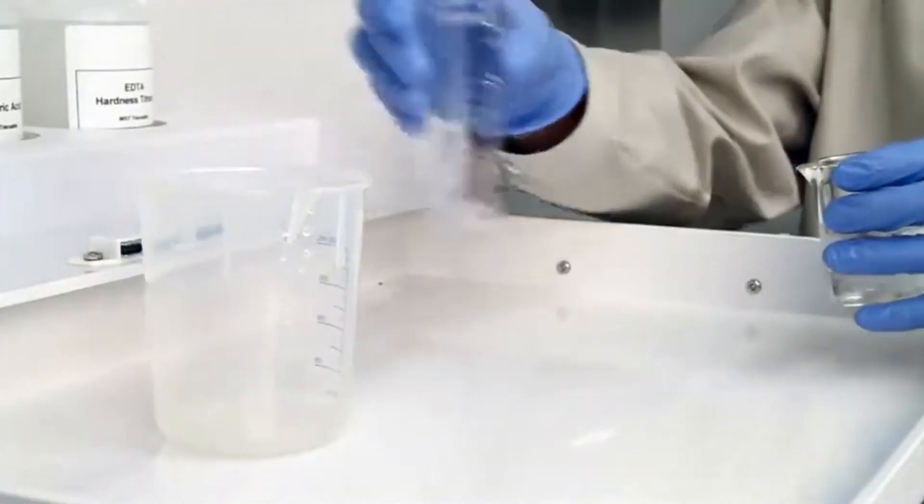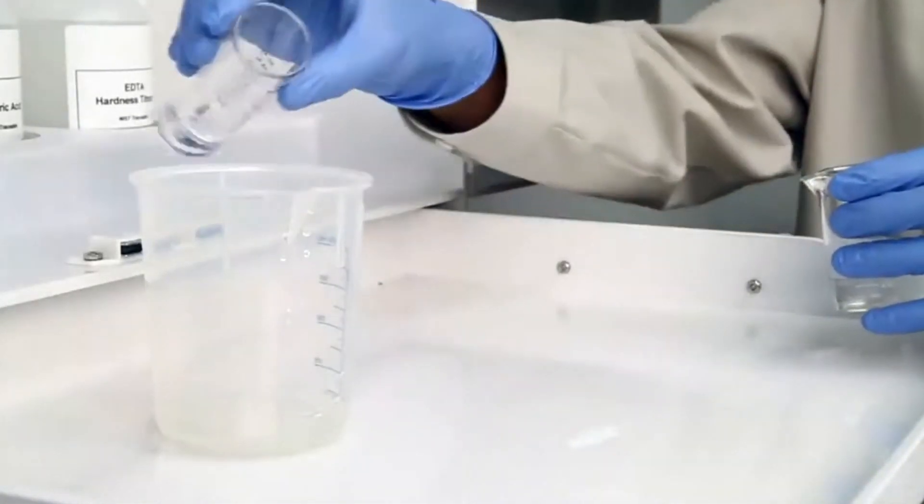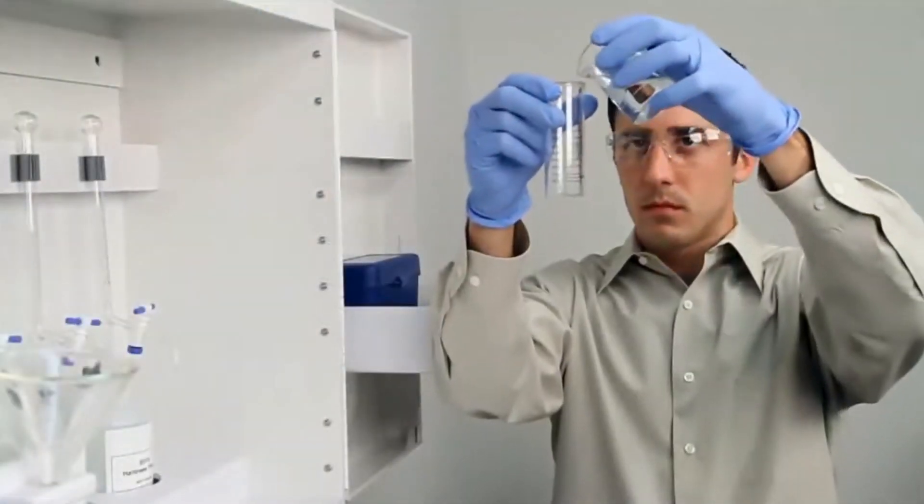Before gathering your sample, it's important to rinse the vial three times with the sample to be tested. This minimizes the chance of contamination from a previous titration.